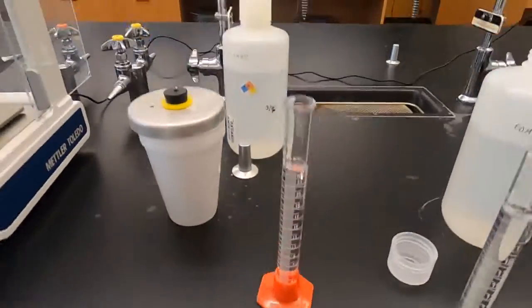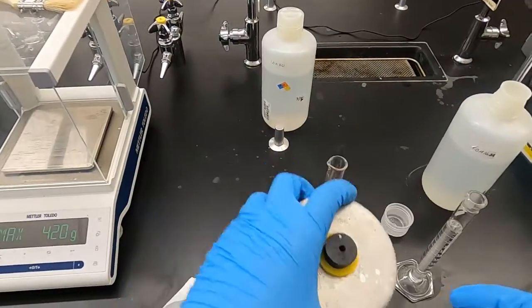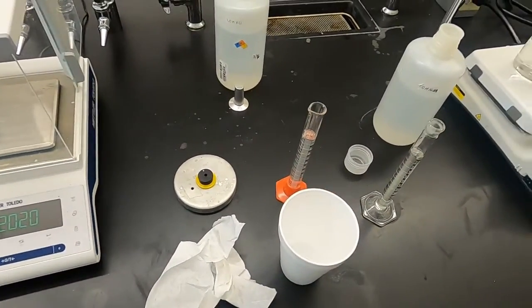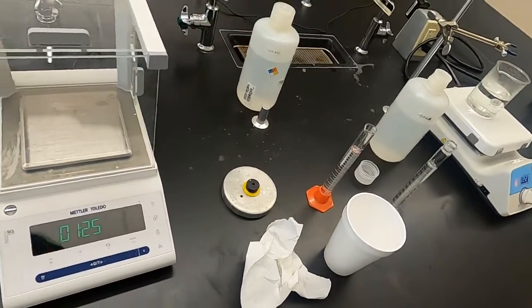So again, this is a clean calorimeter, which has not been used with any of the other samples. If you're in the lab, you would be drying your previously used ones. Everyone would probably be sharing for the most part on these.